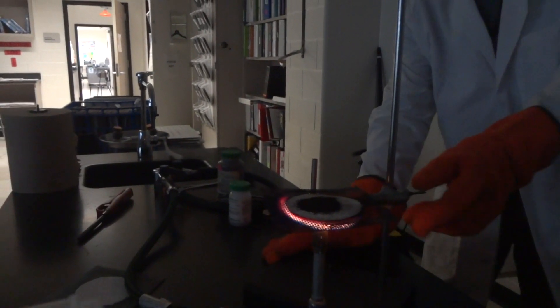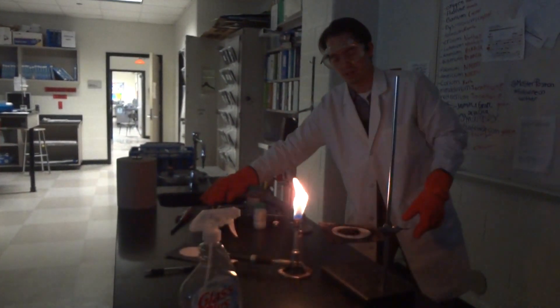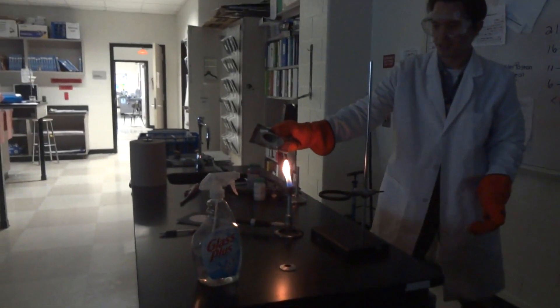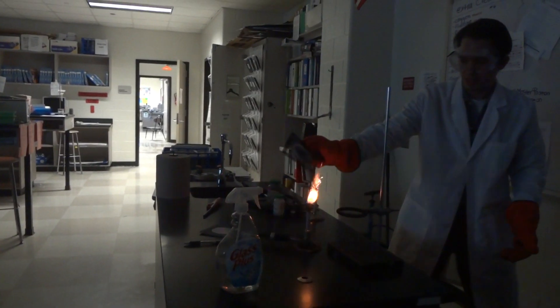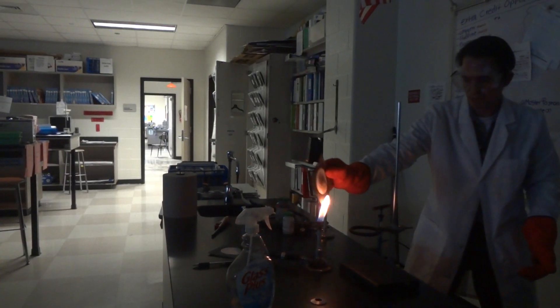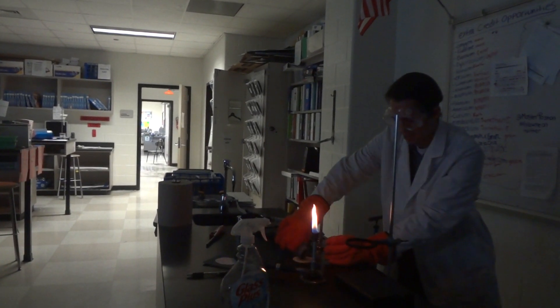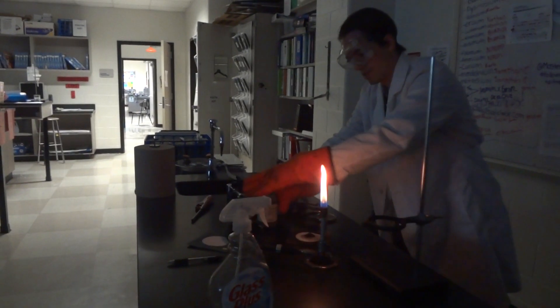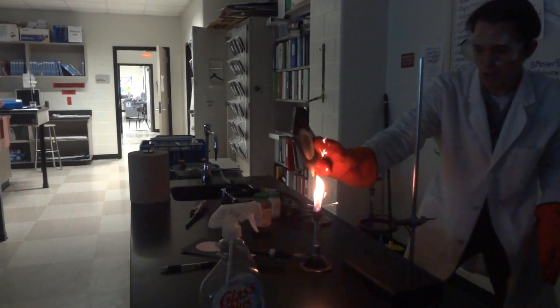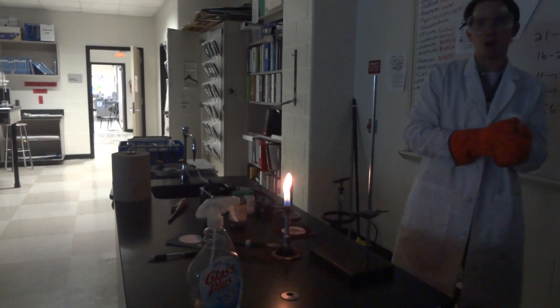Let me show what happens if it is poured on the flame. Let's lower that flame a little bit. Here's the iron — just watch carefully, it's going to happen really quickly. We're just going to pour it on here and see what happens. See the sparks? They're like fireworks. That's iron. So that's it for iron — it was reactive, but not really that reactive. Record those observations on your sheet. Write down what you saw: it produced sparks, a little bit, but not too much.